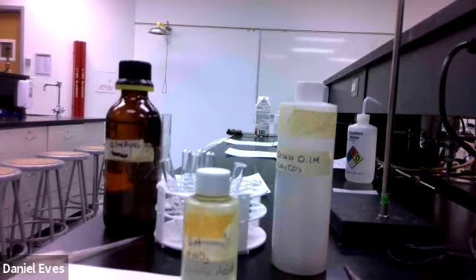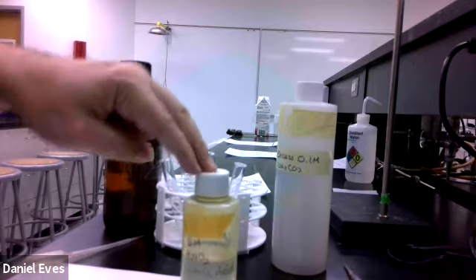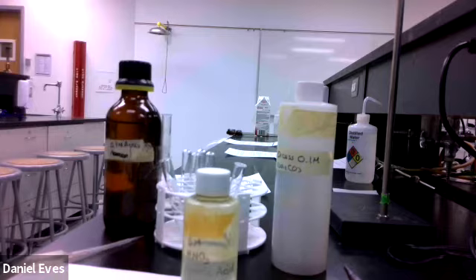Okay, so it was solid, whatever the thing is paired with carbonate, reacting with the acid, and then we get water, carbon dioxide, and the ion that's left over from that. So there should be some nitrate and whatever that other piece is. All right, so that's experiment B. Go ahead and write up your equations and figure out how that goes together.